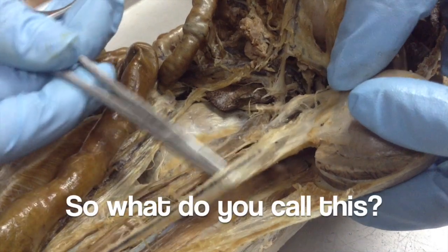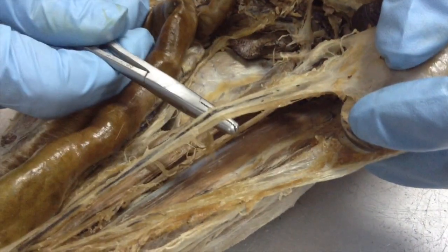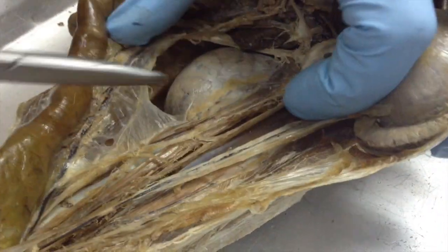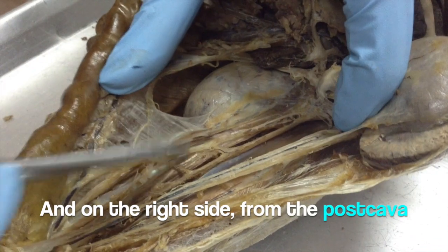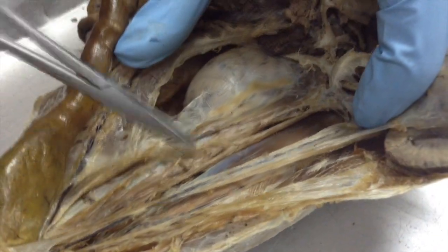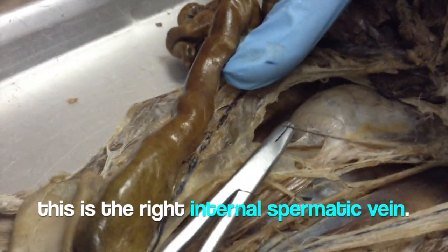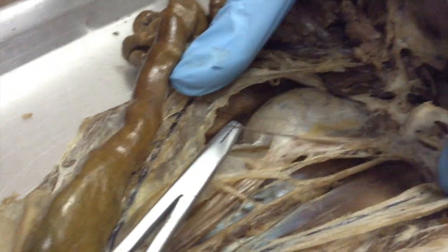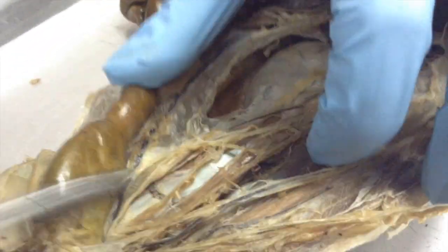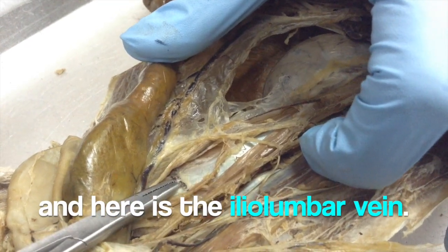From the left renal vein, this is the left internal spermatic vein. On the right side, from the post-cava vein, this is the right internal spermatic vein. Again, from the post-cava vein, here is the ilio-lumbar vein.